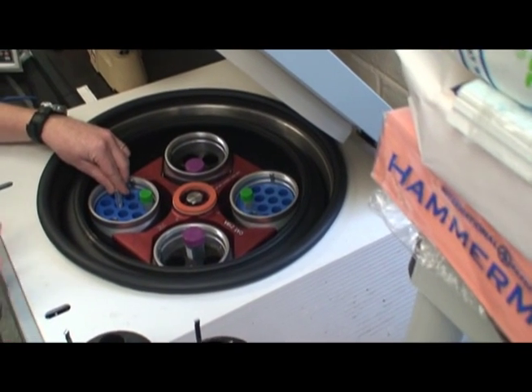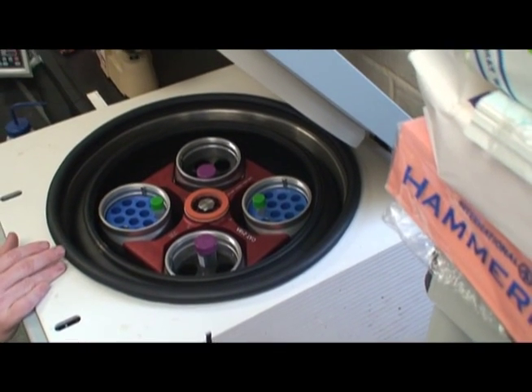A note of caution: microfuge tubes may not be placed into this centrifuge device as they do not fit in any of the holders.